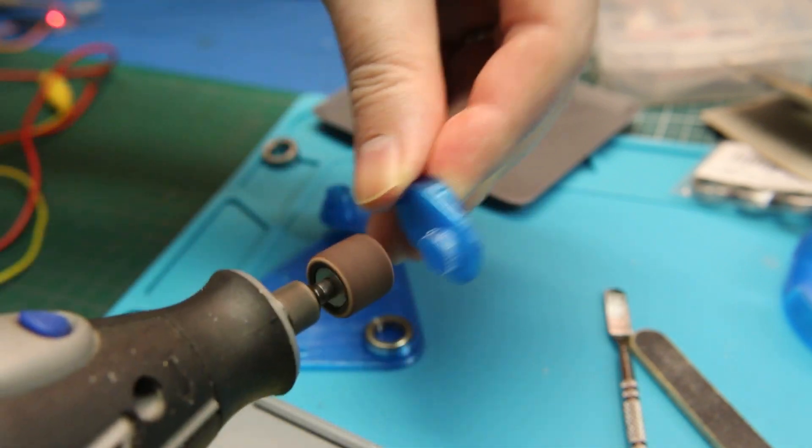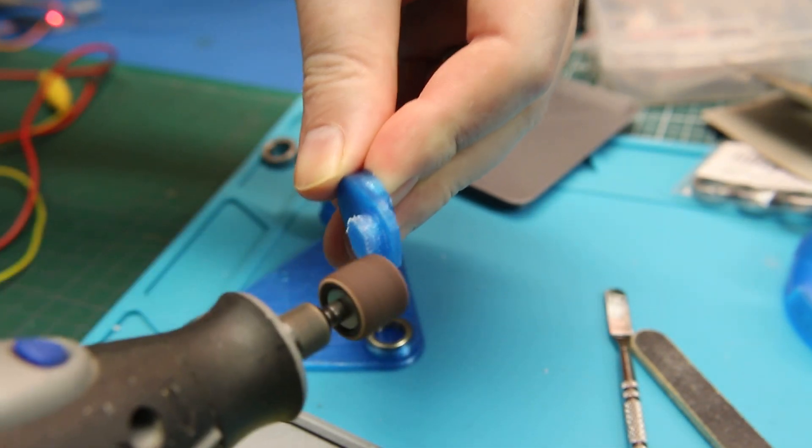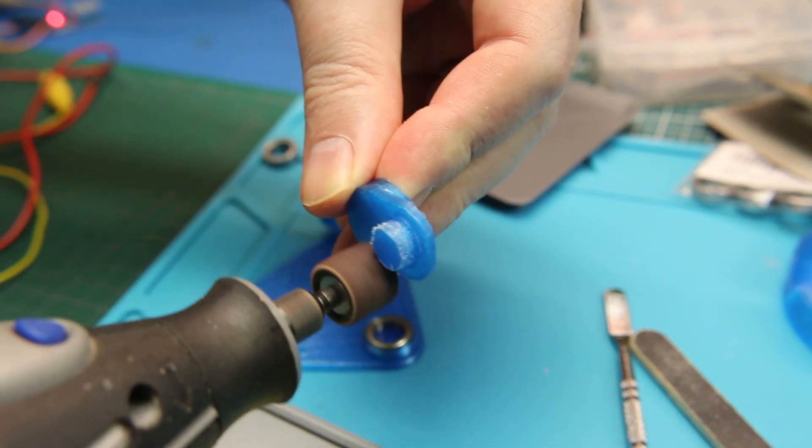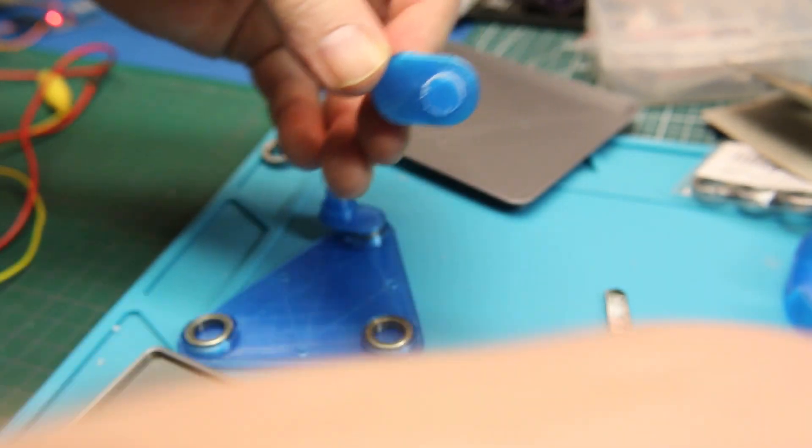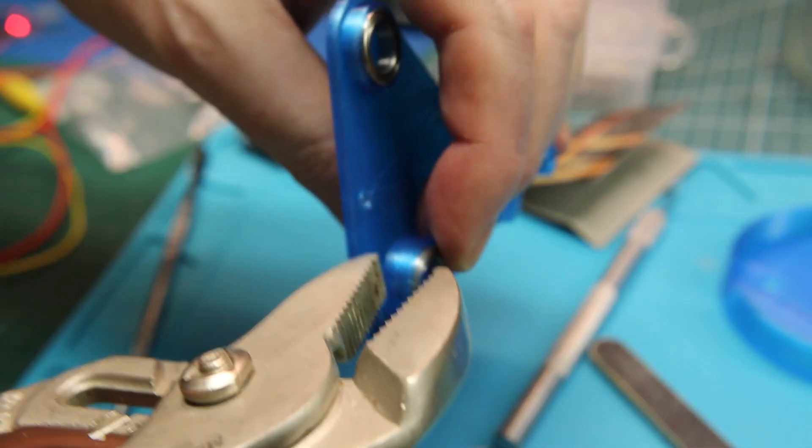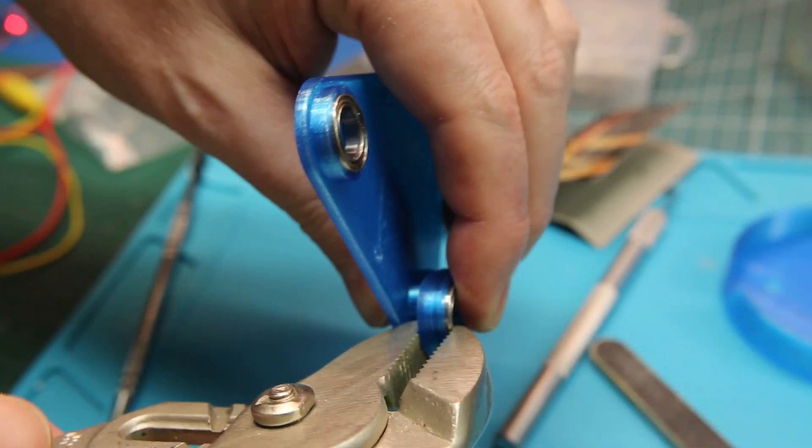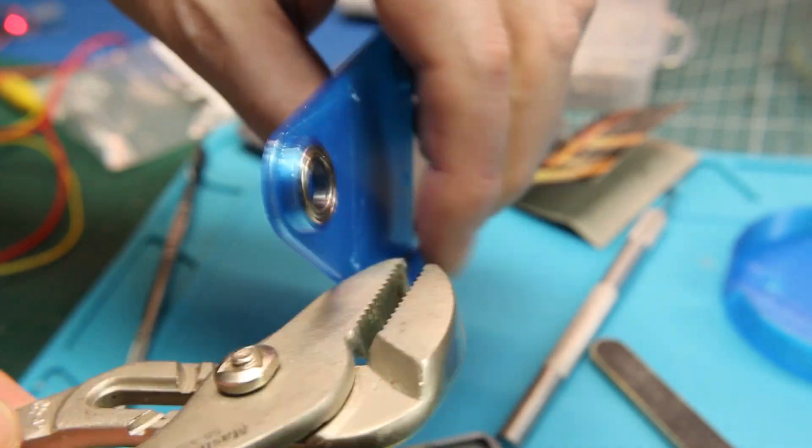I ran into a couple more that were just a little snug, so if you're like me and really rammy, out comes the Dremel tool. Easy peasy. A pair of channel locks can help get the bearings home as well.